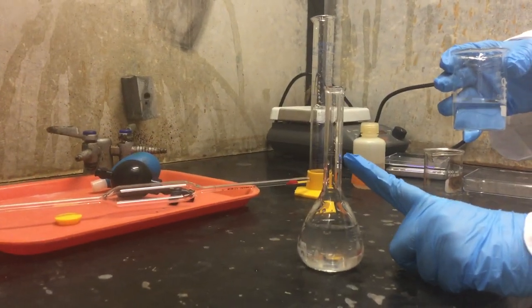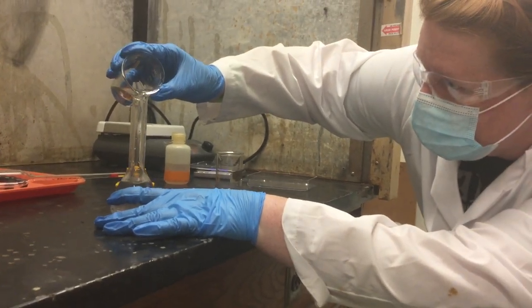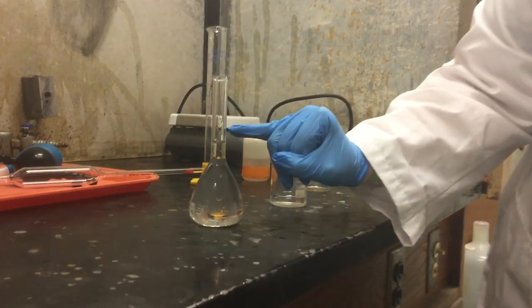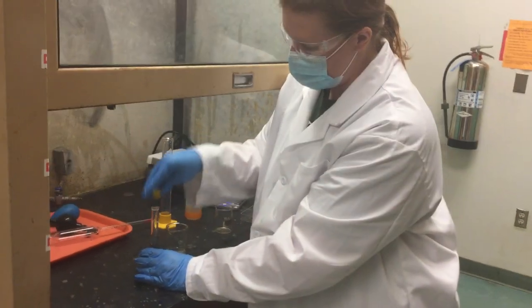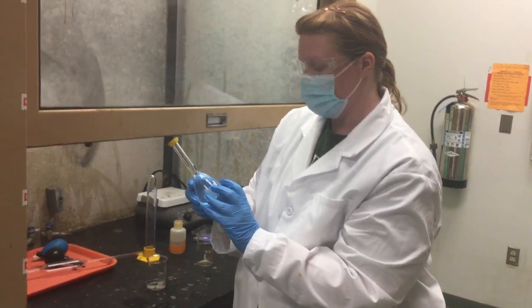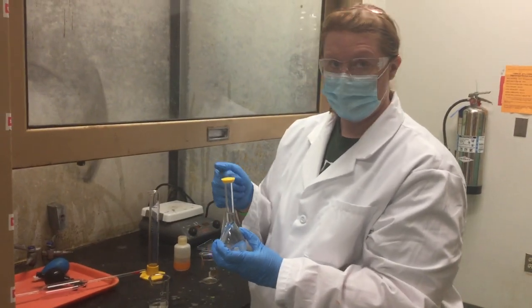Your final dilution needs to be done very carefully. If you go over the line, it is not valid and you've got to redo it. You can see there's an etched line — this will be in different places depending on the flask because they're each calibrated individually. Get down to eye level. You can pour pretty quickly until you get near it, but leave a little space. Then use a pipette to fill up to the last bit with water. Make sure the meniscus just barely touches the line — not over, not under. Once it's just right, put the cap on. Most flasks are labeled with a cap size; this one says cap 4, so use cap size 4. It's either going to be 3 or 4 for 100 mL flasks. If it feels too difficult to put on, don't force it — you'll break the cap.